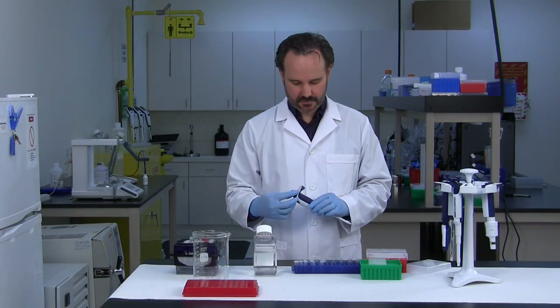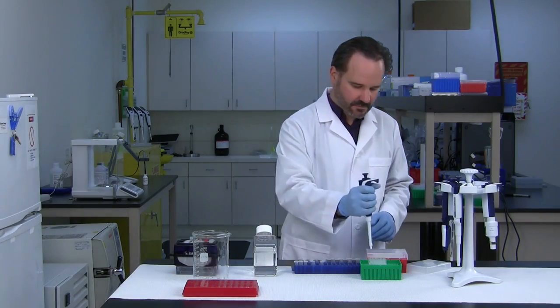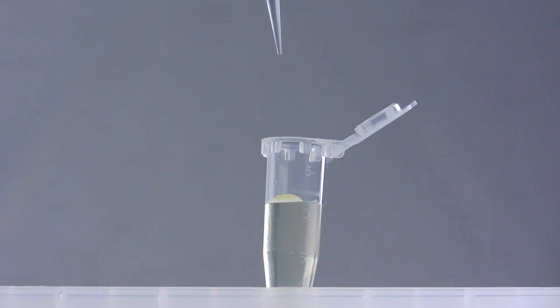Two other dispensing techniques also work well with aqueous liquids. First, dispense the sample directly into liquid during blowout, being sure to touch off before removing the tip.